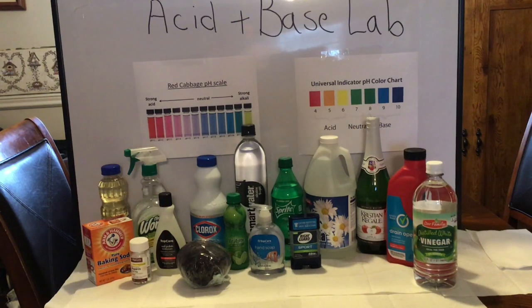All right, welcome everyone to our Acids and Base Lab, which you may know as I shot in my dining room the other day, and I had help from my children. You'll see my third on there, Jude Nicholas, helping us out.